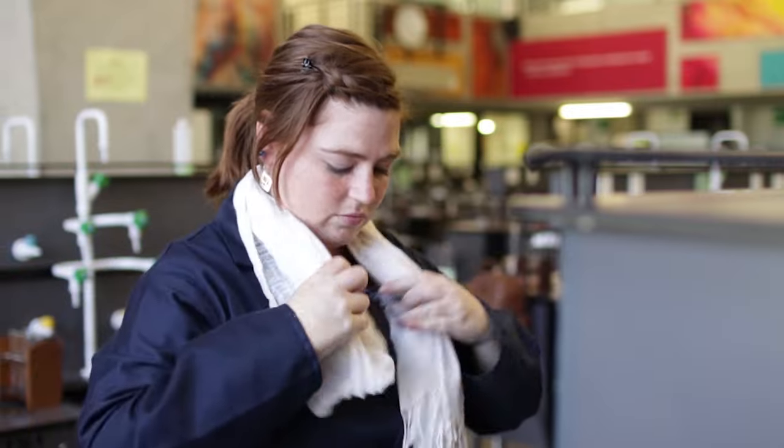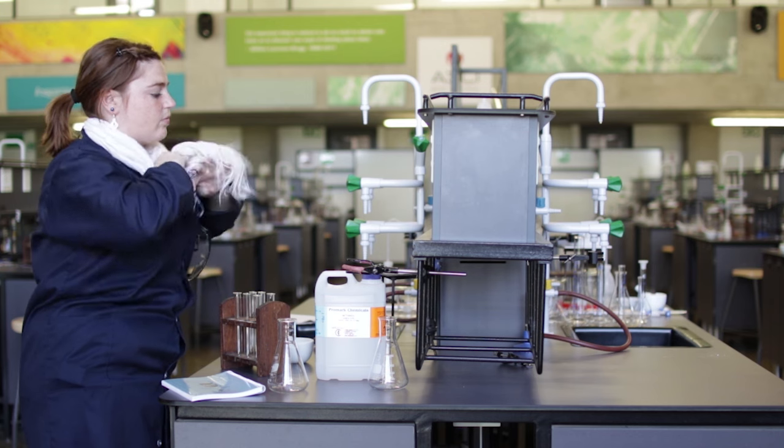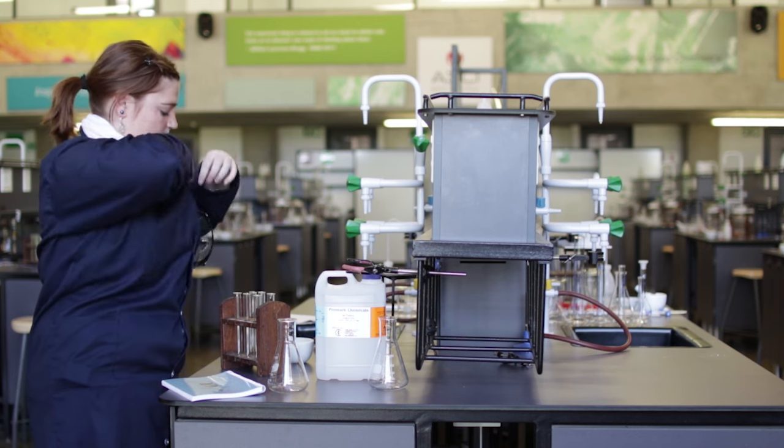Before you light your Bunsen burner, make sure that long hair is tied back and any loose clothing is tucked away safely inside your lab coat.